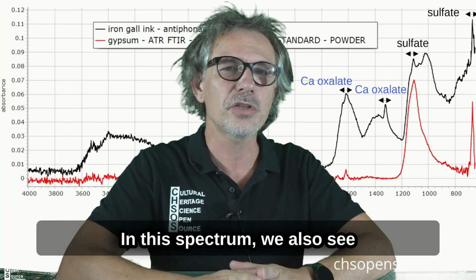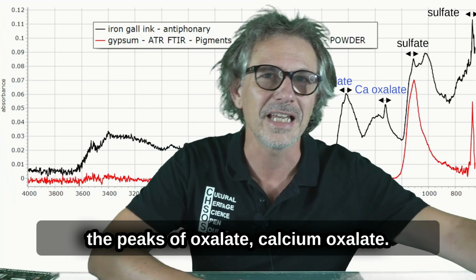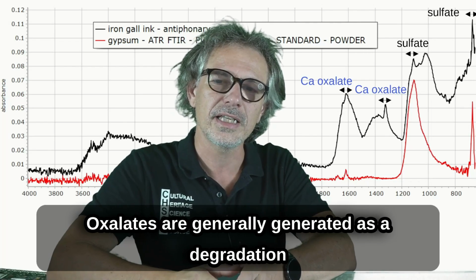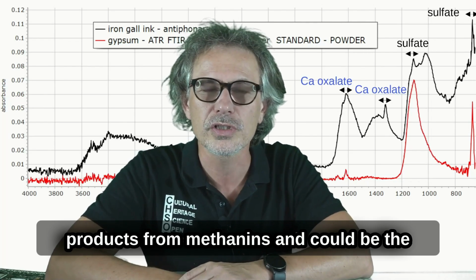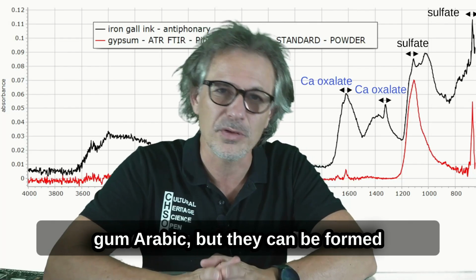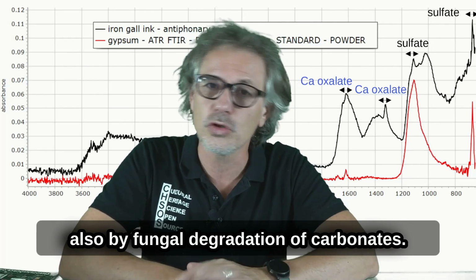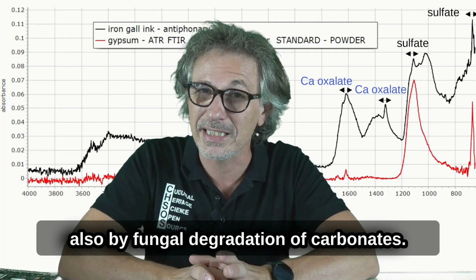In this spectrum, we also see the peaks of oxalate, calcium oxalate. Oxalates are generally generated as degradation products from tannins and possibly from gum arabic. But they can also be formed by fungal degradation of carbonates.